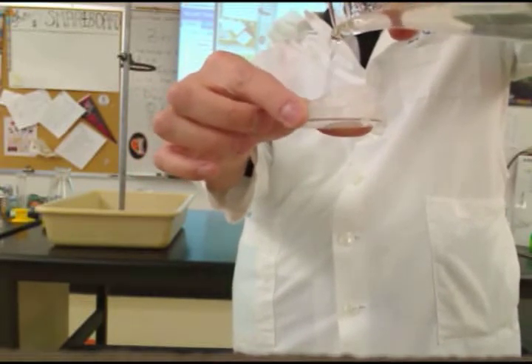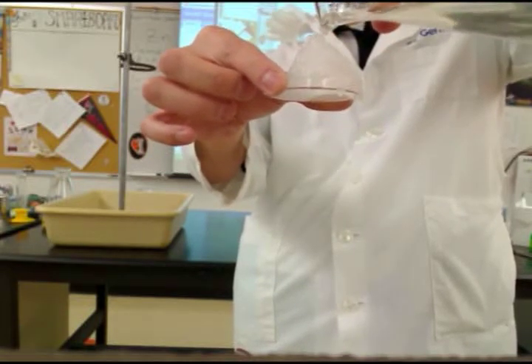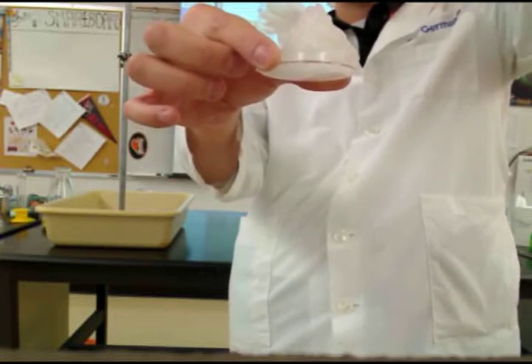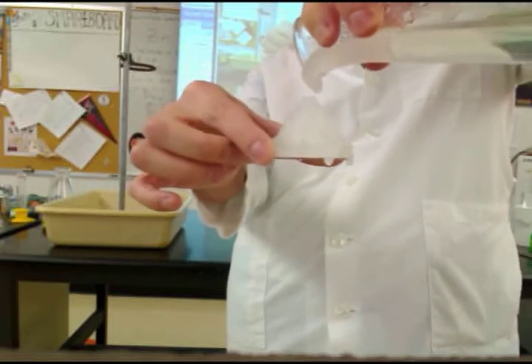Oh, I spilled it. Oh, I spilled it. What the heck? What are you doing? You're lifting it too high. Oh, I am.